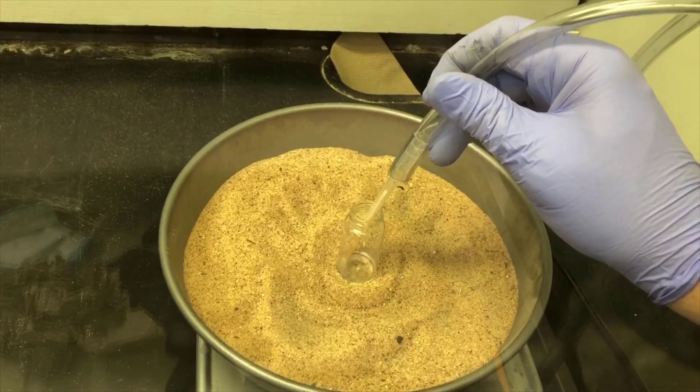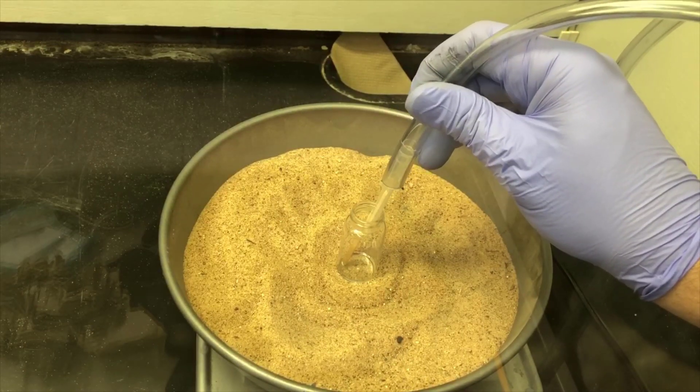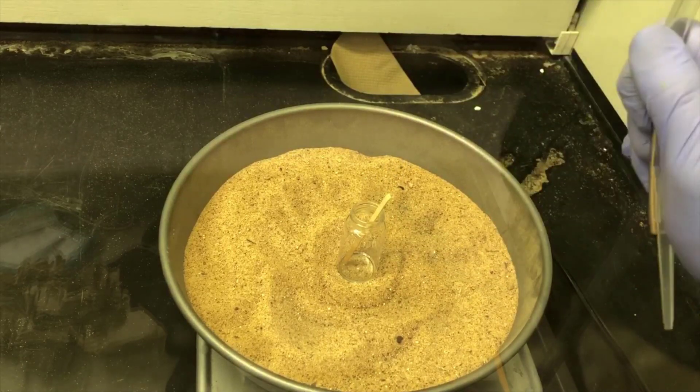You can also speed up the evaporation by blowing a gentle stream of air into the vessel as it's boiling. Ether evaporates fairly quickly, and pretty soon all the ether will be gone and the bubbling will stop.